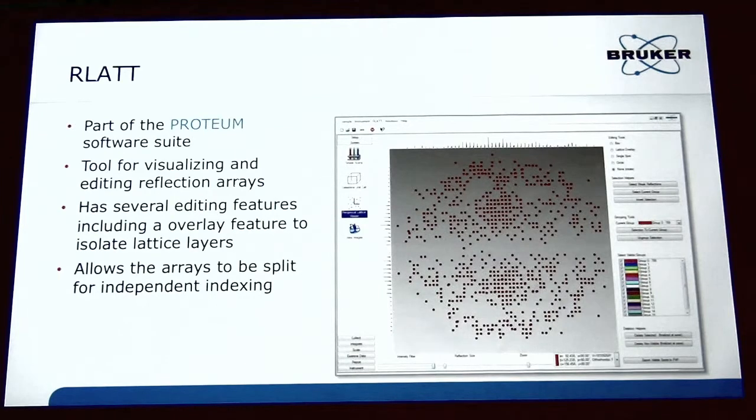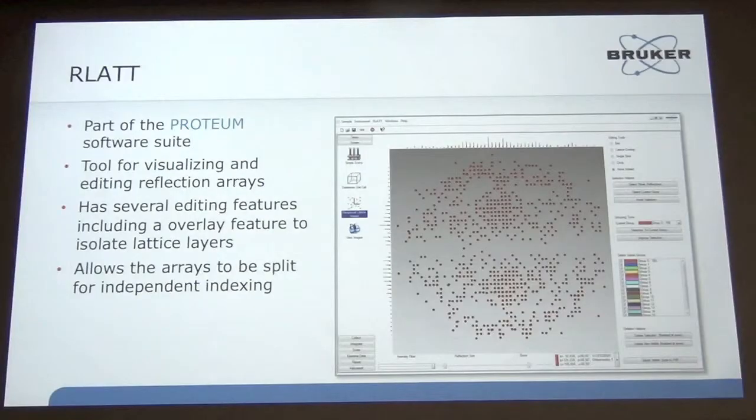So one way that RLATT helps you is you just look at what the reflection array looks like. And when I try to index something, the first thing I do is come in here, and it's usually quite obvious what's going on. It's got a bunch of graphical tools. It was originally written as a teaching program, so it has a lot of ways to display unit cells. But the thing that's most useful is just editing and visualizing the reflection array. And I can rotate this in 3 dimensions, I can add different scans, and it'll all show up exactly how it would be in reciprocal space.